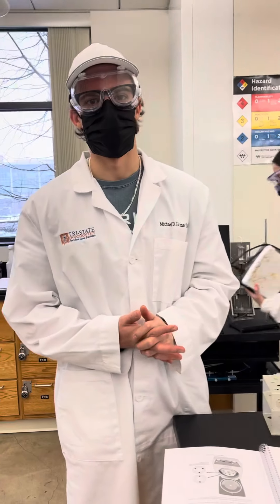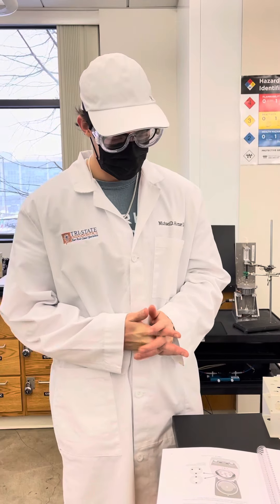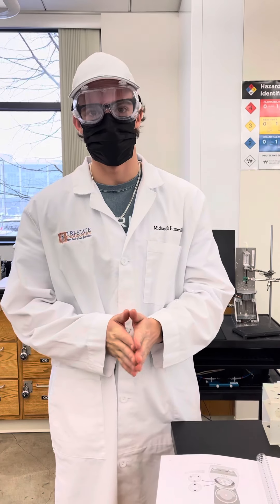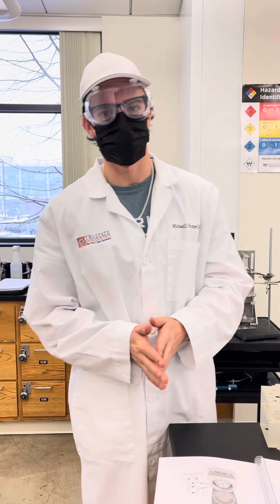I'm Britton Homer. My TA is Holly and this is going to be the Centrifuge and decanting process skills video.